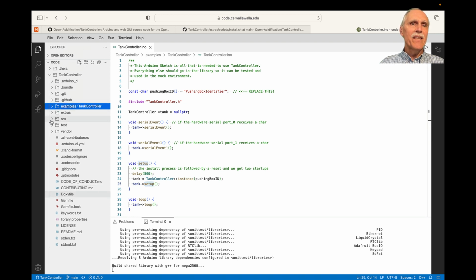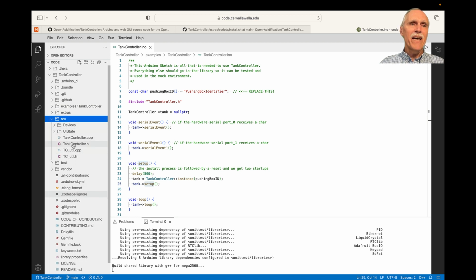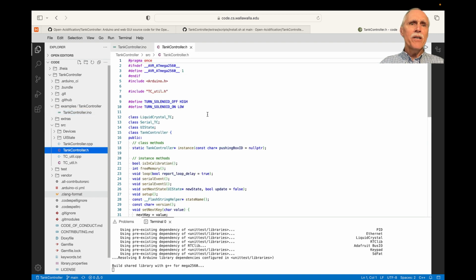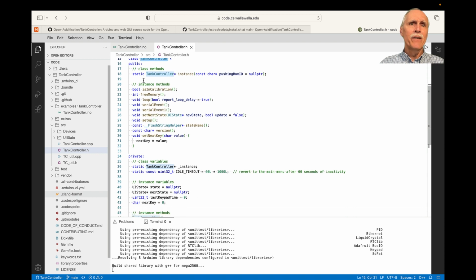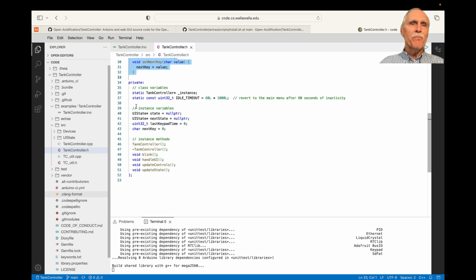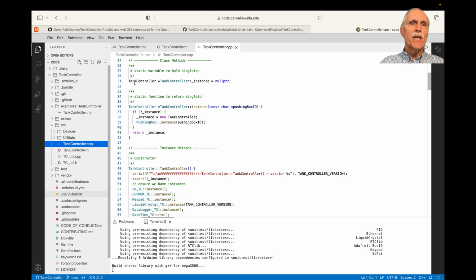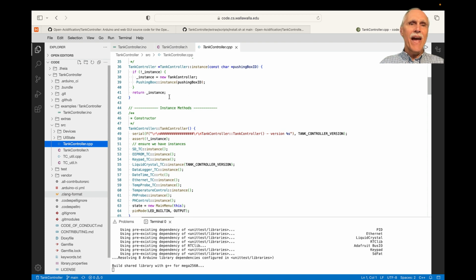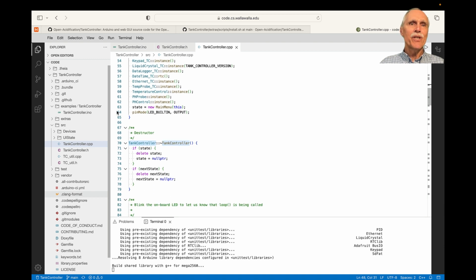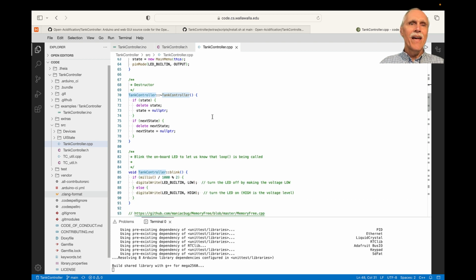Our library is in the source directory, and it's made up of tankcontroller.h, which was included in the INO, as well as a .cpp file. So our .h file defines the class TankController, has a static method that returns the singleton of the TankController, then a few instance methods, as well as private variables and methods. The CPP file for the TankController includes variables to hold the singleton, methods to answer the singleton, a constructor to create the instance and do some initialization, including getting singletons for each of the required pieces, a destructor.